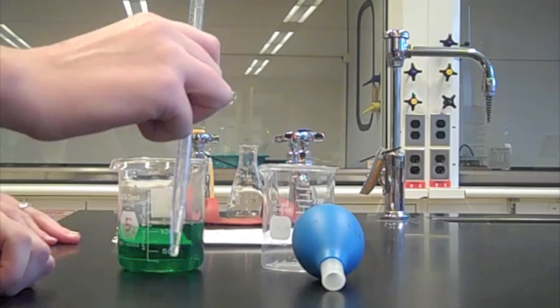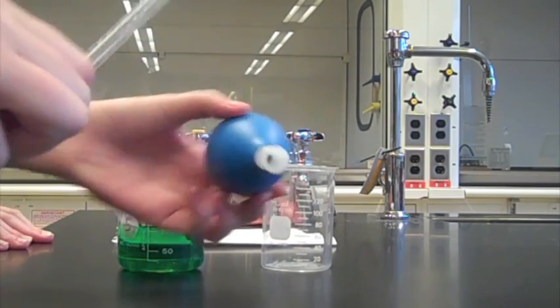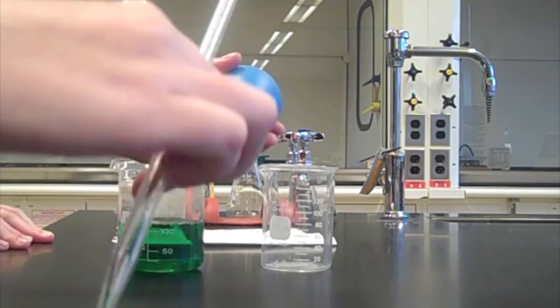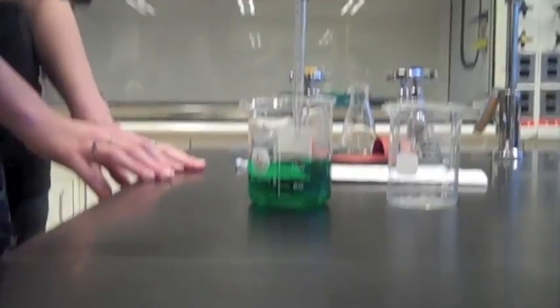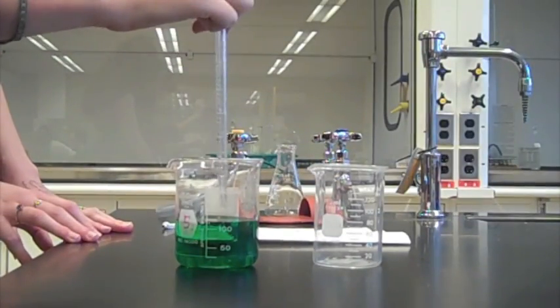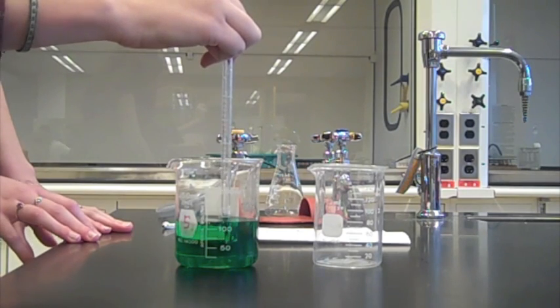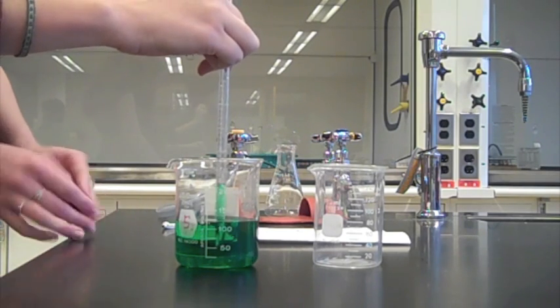Well, first you get a pipette and you get a bulb. You put the bulb on top of the pipette, but first you squeeze it. You insert the pipette into the solution and slowly release the bulb so liquid is drawn up.